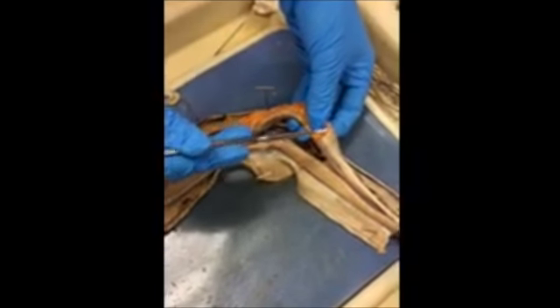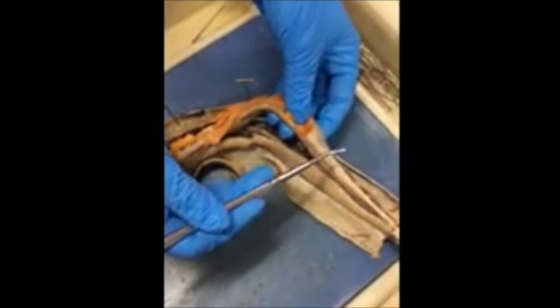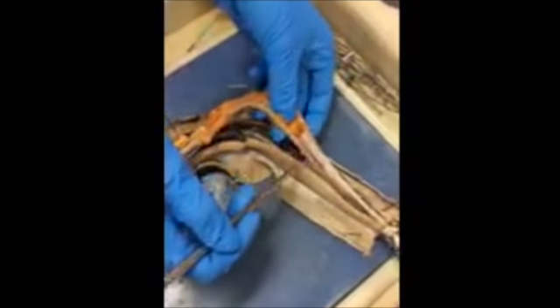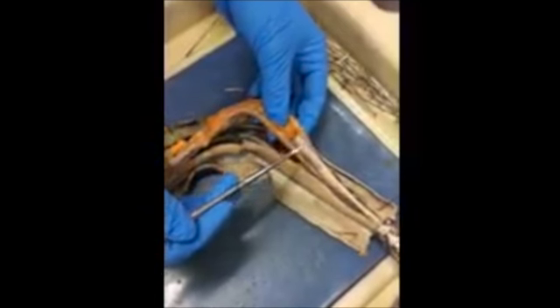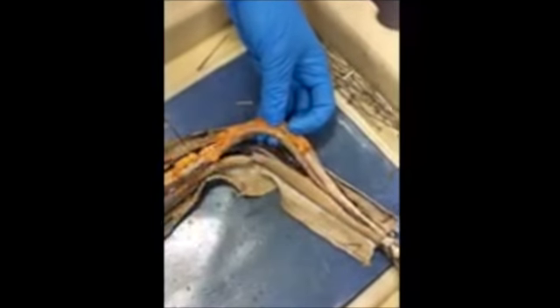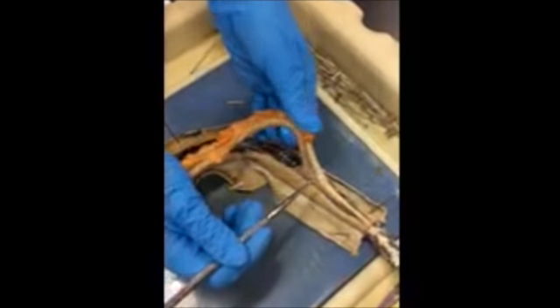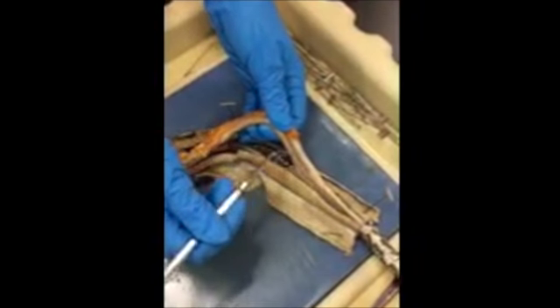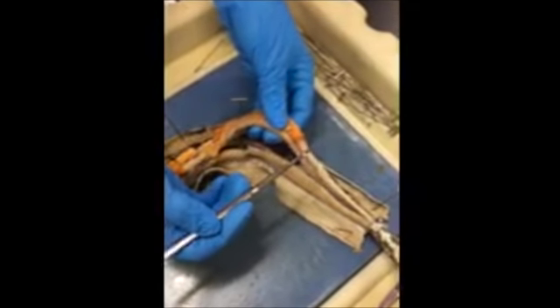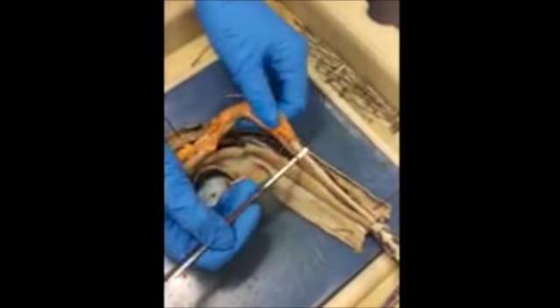The main organ of the snake's excretory system is a metanephric kidney. These are the kidneys, which filter out waste from the blood. Blood is transported to and from the kidneys by the renal portal system. Renal arteries and veins deliver blood directly to the kidney.